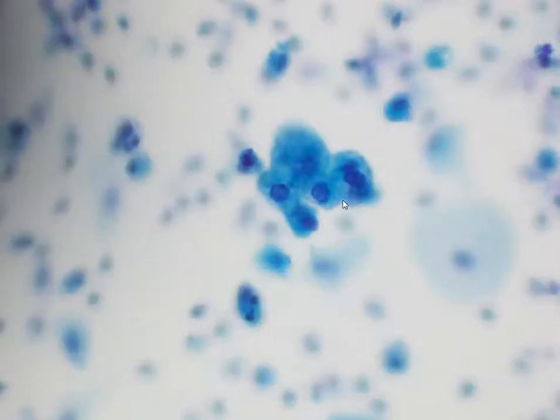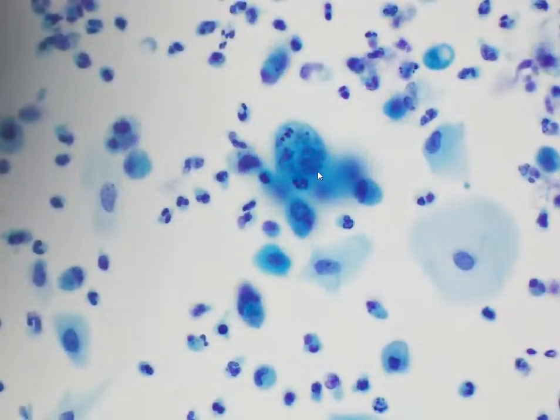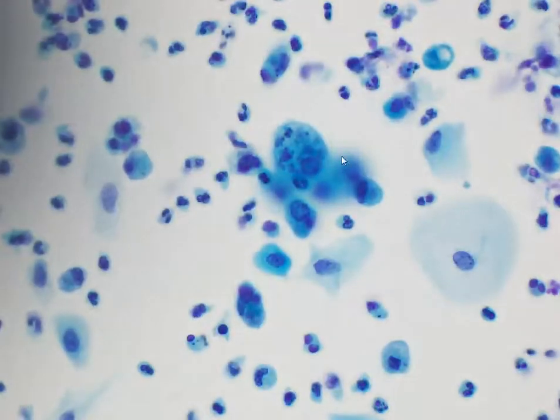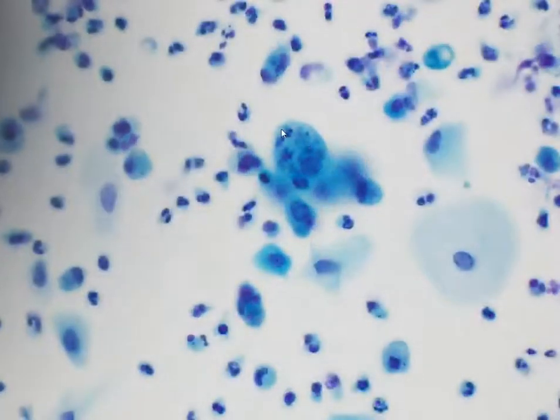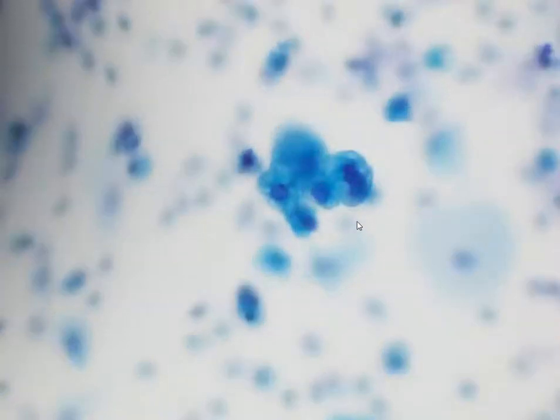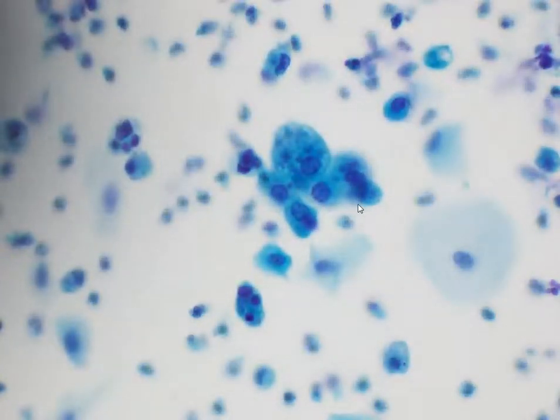Here is another cell group where we can actually see that the nuclei are quite large and we can just about appreciate prominent nucleoli. At the same time, we can see the neutrophils and degenerate cell material within the cytoplasm.